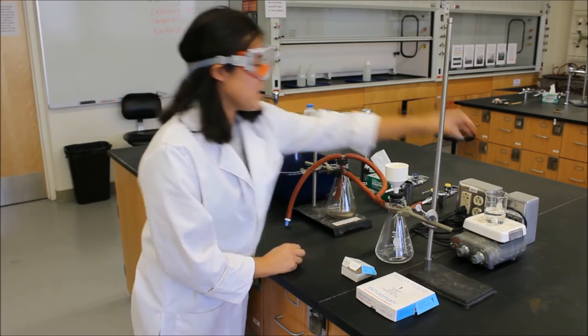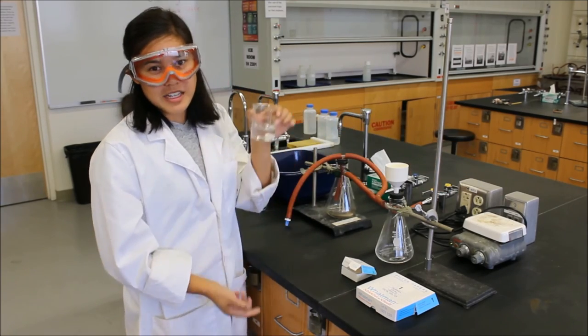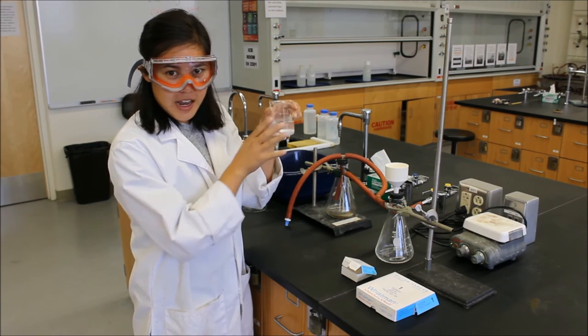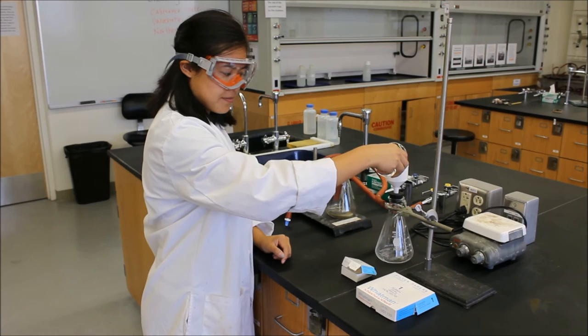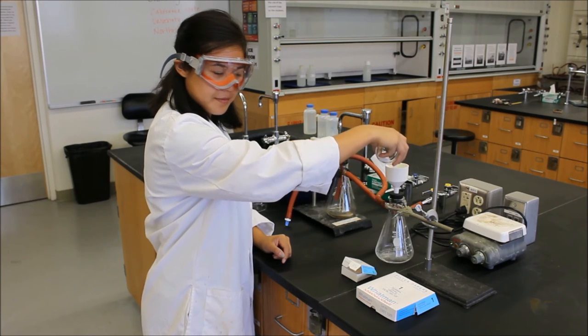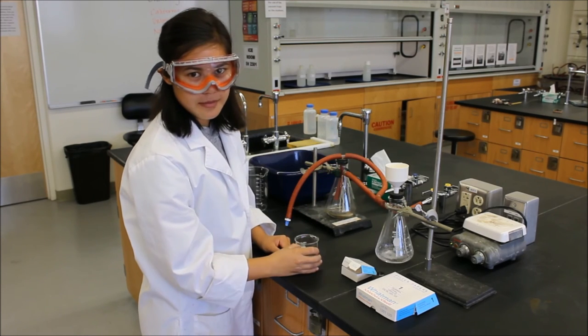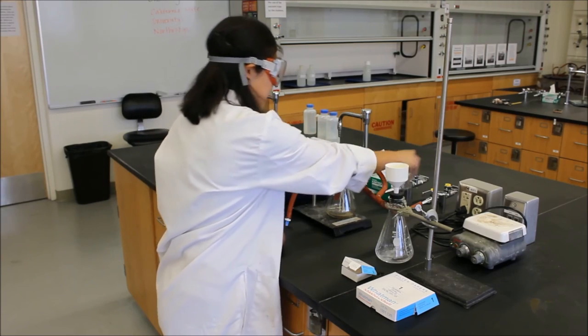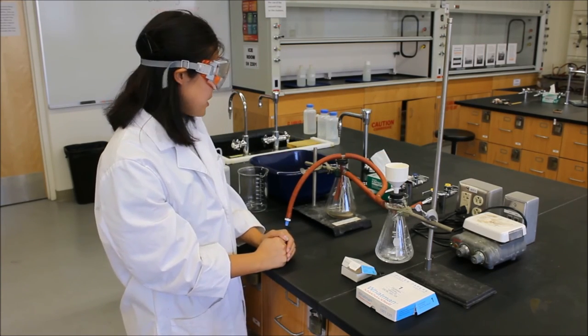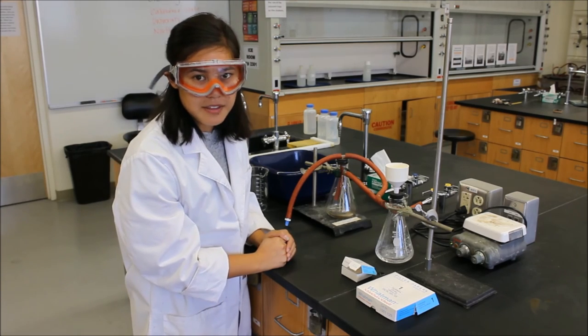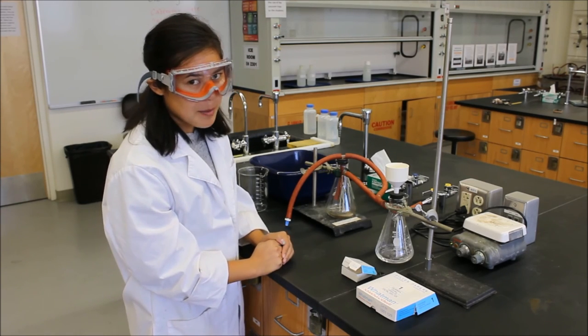So once you have it on, you can go ahead, we'll pretend that there are crystals in here, and you can just go ahead and pour it into your filter. Magic. After you do this, you're going to need to learn how to make an ice bath. It's pretty simple. It's an ice bath.